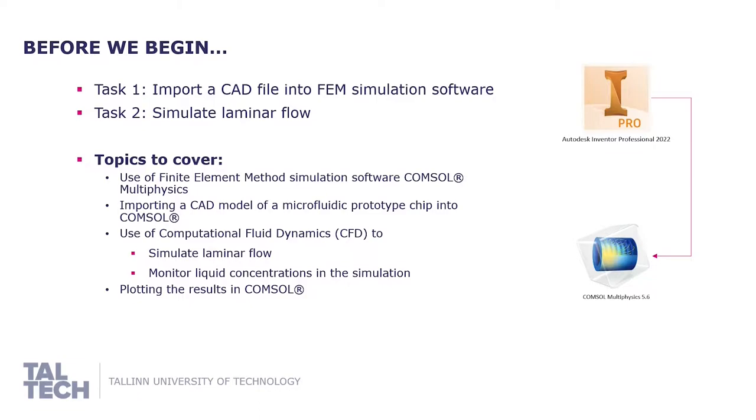CAD model that represents a physical microfluidic prototype into COMSOL, use of computational fluid dynamics to simulate laminar flow and monitor liquid concentrations in the simulation. And lastly, plotting the results in COMSOL.